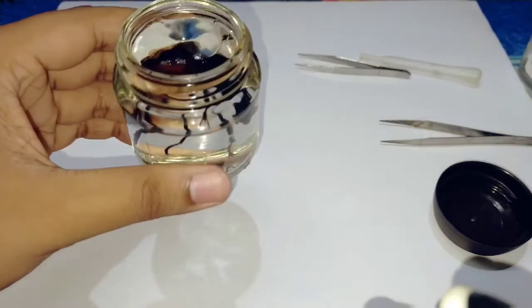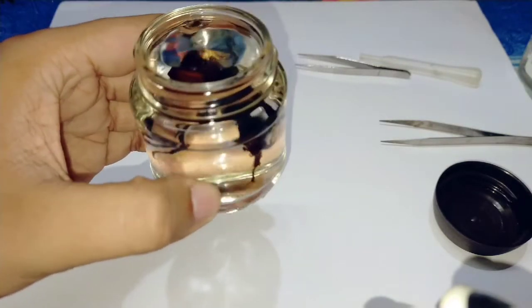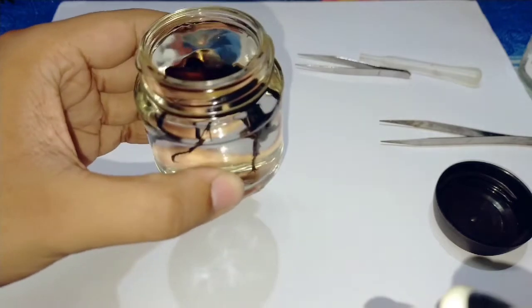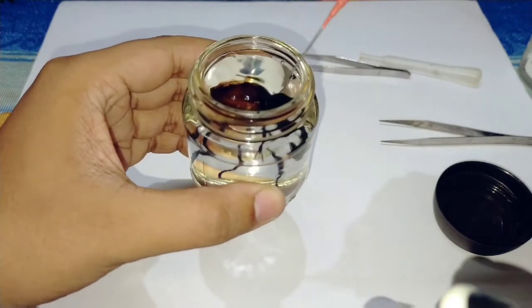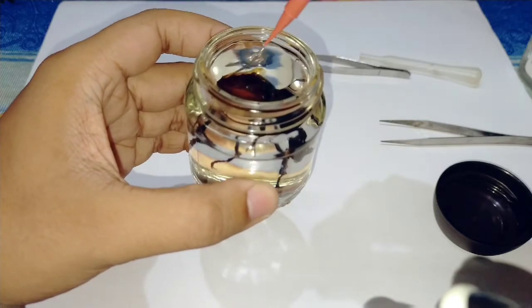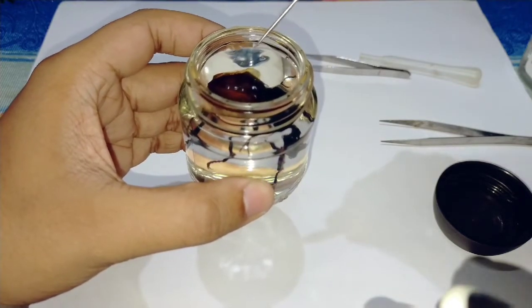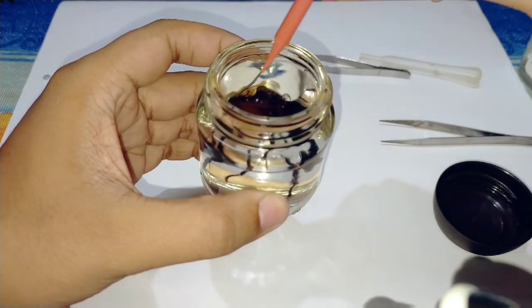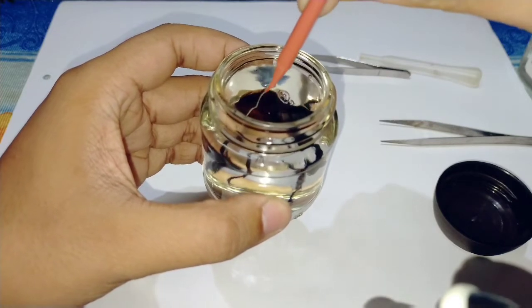Now you can see, the container is full. If you want to place it in proper position, use this needle and place it in proper position.